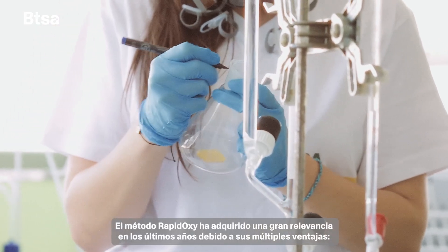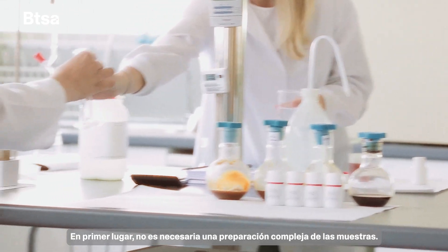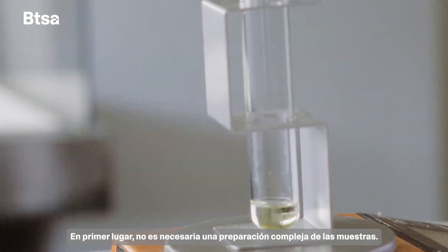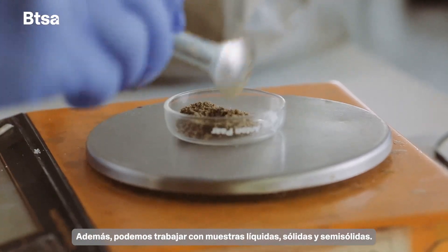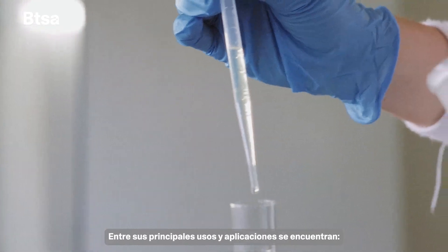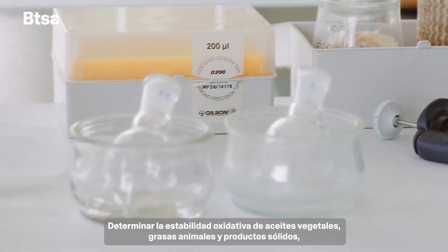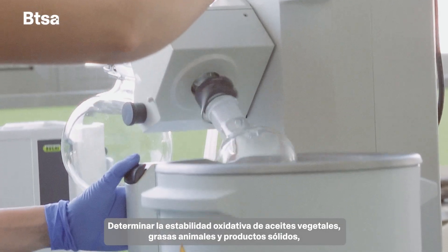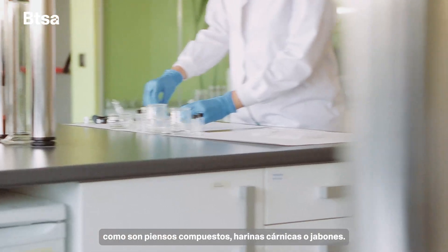The rapidoxy method has acquired great relevance in recent years due to its many advantages. First of all, it does not require complex preparation of the samples. In addition, we can work with liquid, solid, and semi-solid samples. Among its main uses and applications are determining the oxidative stability of vegetable oils, animal fats, and solid products such as compound feeds, meat meals, or soaps.